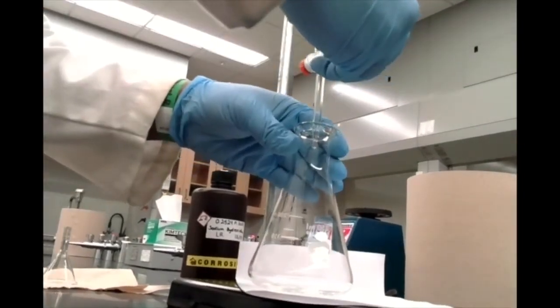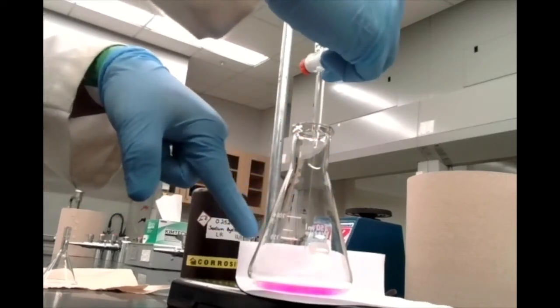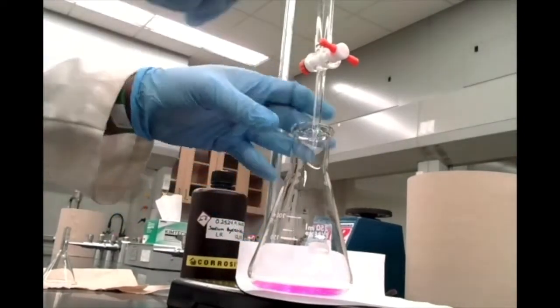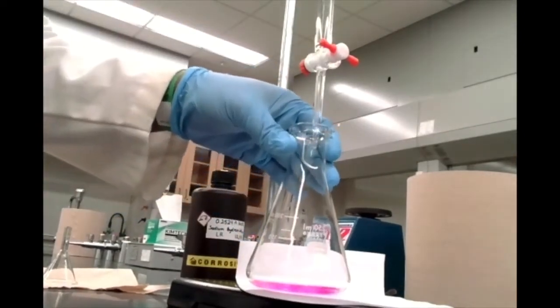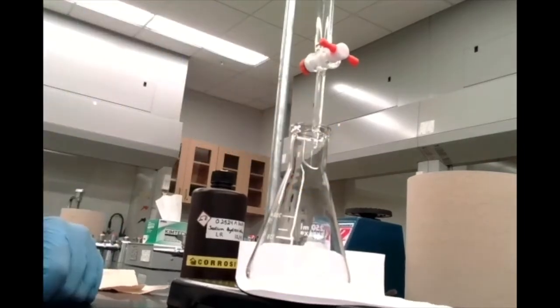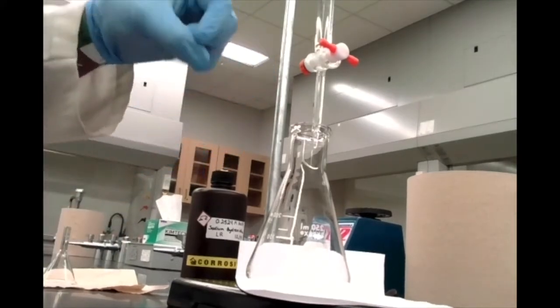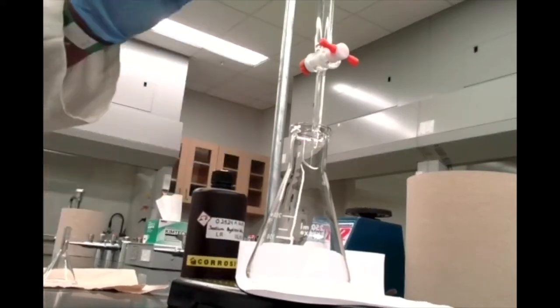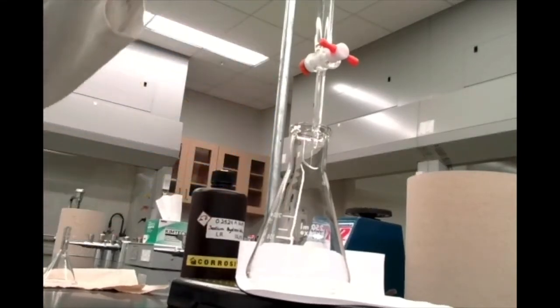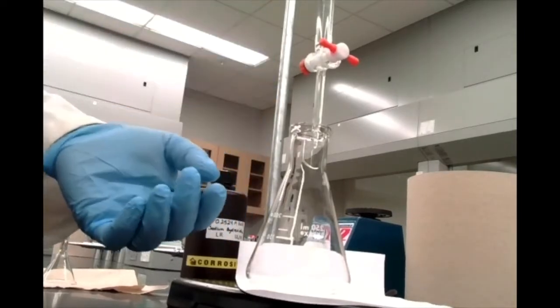Now, as I start running some sodium hydroxide in there, you can actually already start to see some pink color showing up where the sodium hydroxide hits the solution. But now watch what happens when I swirl this. That pink color immediately disappears. The reason for this is that those localized drops of sodium hydroxide hitting that solution are neutralizing the vinegar, the acetic acid, in those localized regions. And that's where you're seeing that pink color.